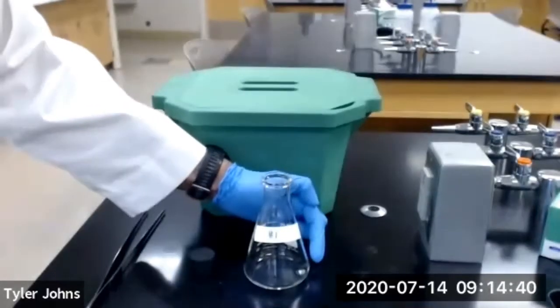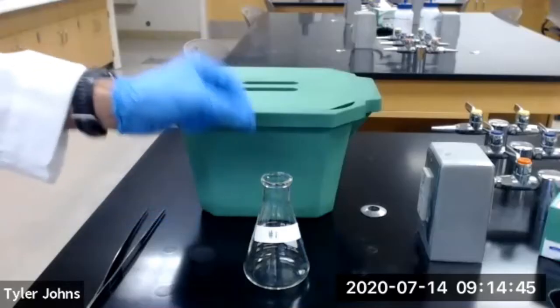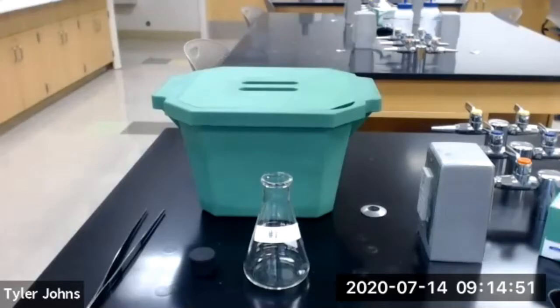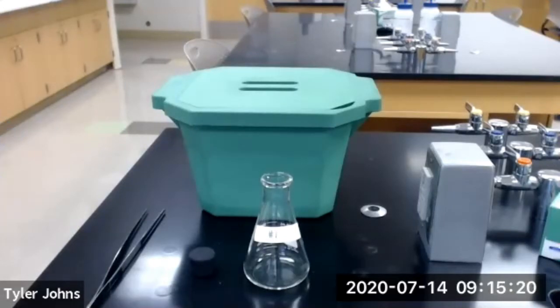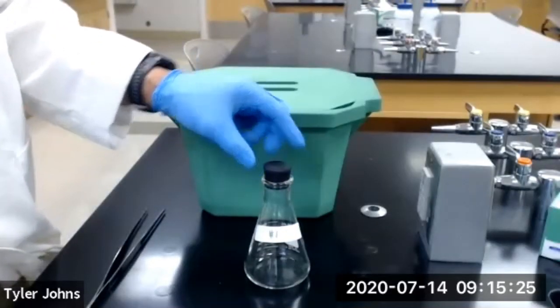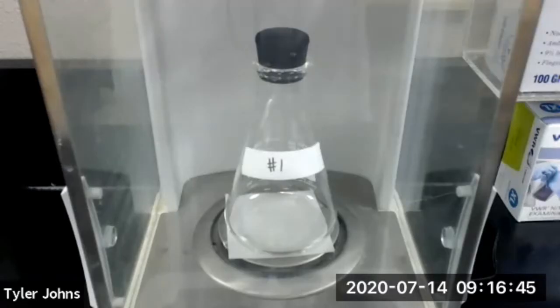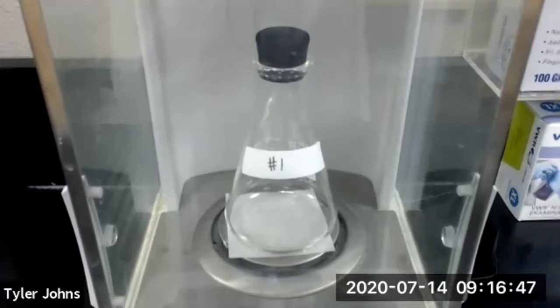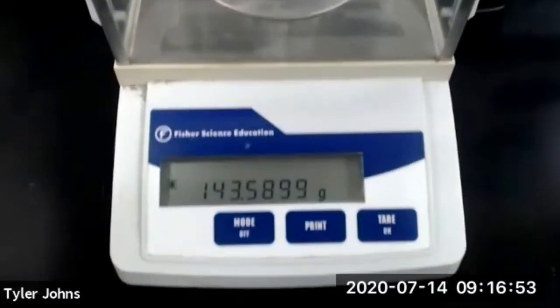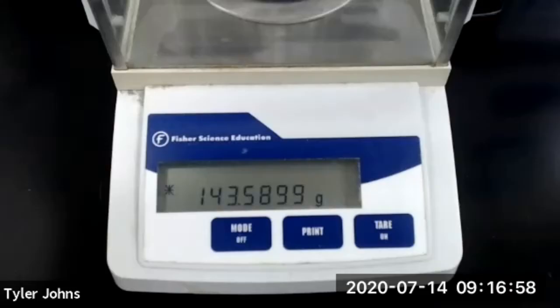Our dry ice has now completely sublimed, so we will stopper our flask and determine the mass of our flask, our stopper, and the carbon dioxide gas inside the flask. The mass of our Erlenmeyer flask, our stopper, and our carbon dioxide gas for trial number one is 143.5899 grams.